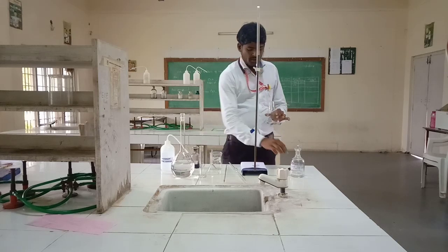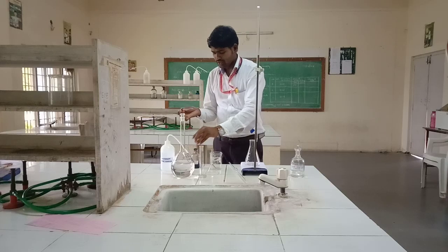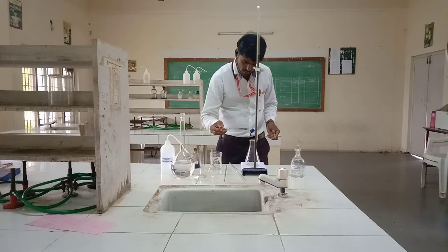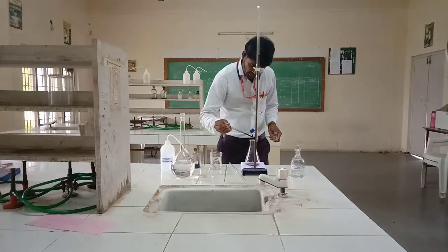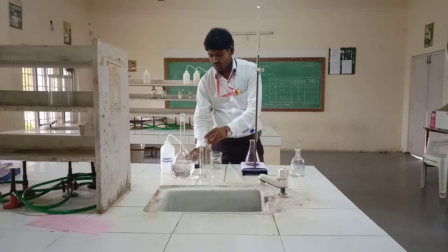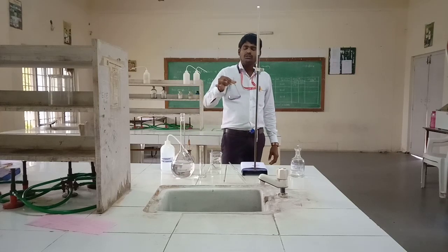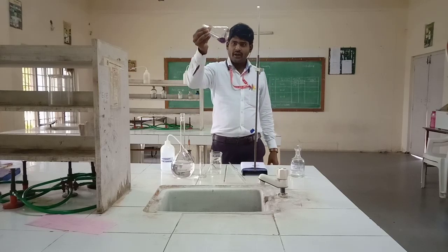Then after, by using a dropper, add the EBT indicator to the conical flask — 1, 2, and 3 drops. So now this colorless hard water sample is converted to the wine red color complex.